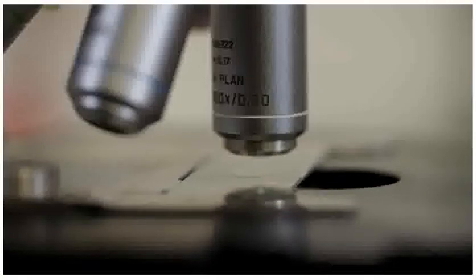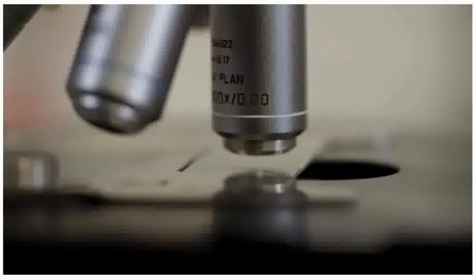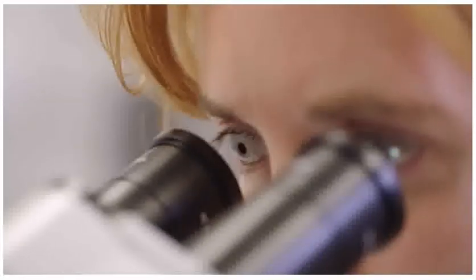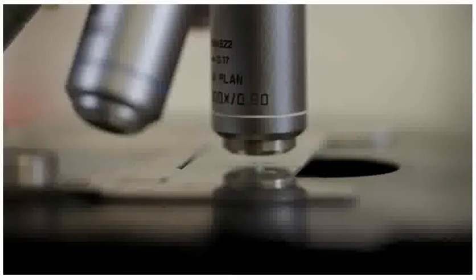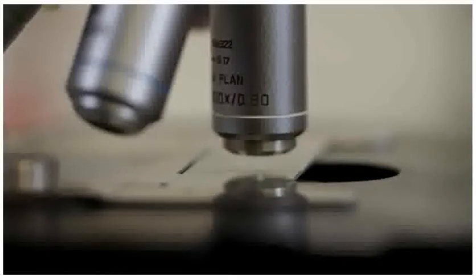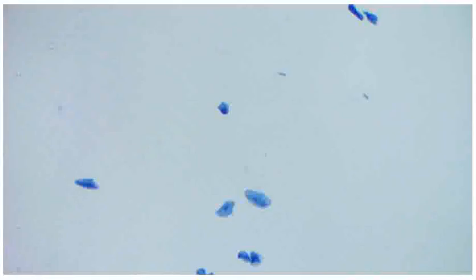Remember not to let the lens touch the slide. The focusing dial is turned so that the stage moves away from the objective lens and stops when the slide comes into focus.